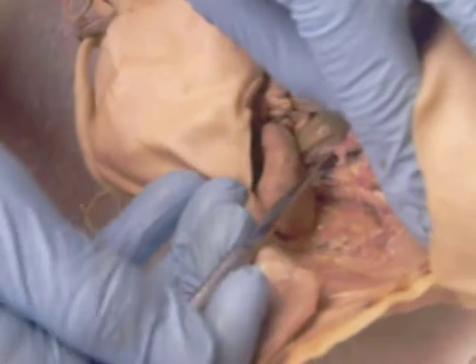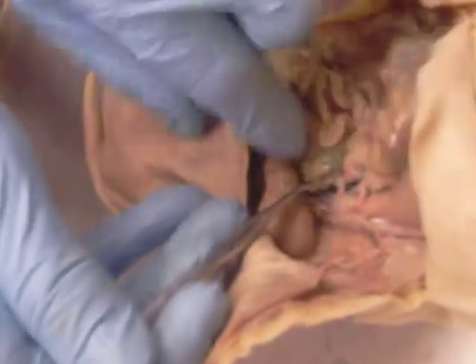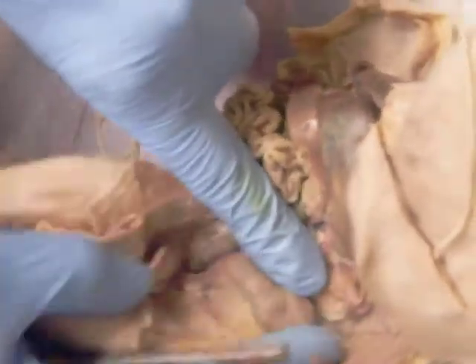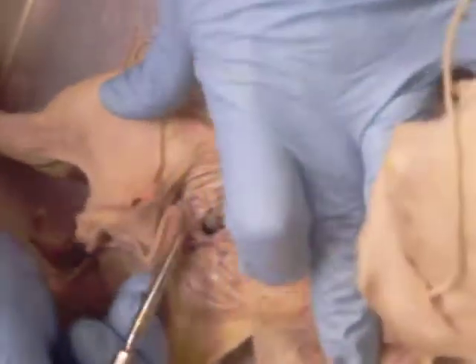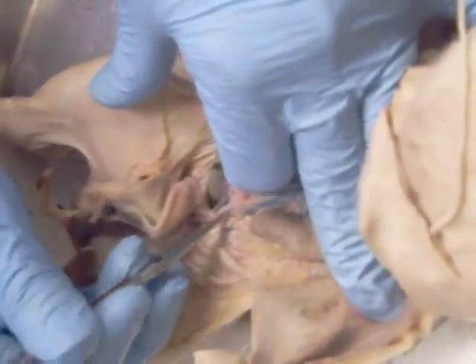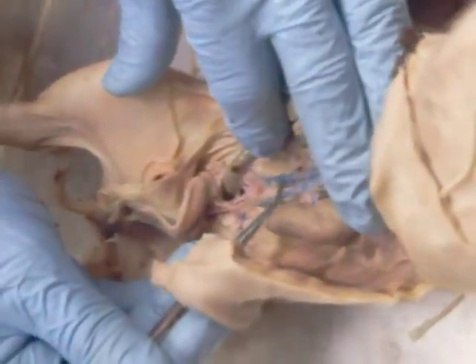I don't know how well you see that. So there are two together. I'll make sure you can see both of them. Celiac here, superior mesenteric. Then going down here is the renal artery and the renal vein. The inferior mesenteric I'm not going to do, but as you get down into this region, you can see the aorta splits. And these are the common iliac arteries going down into the legs. That's about it.